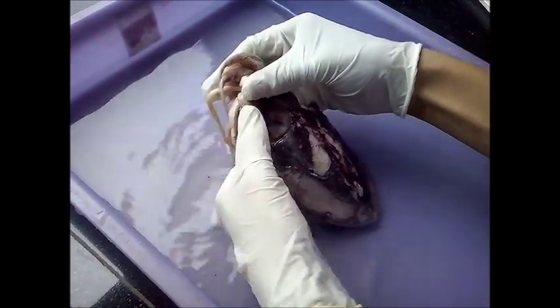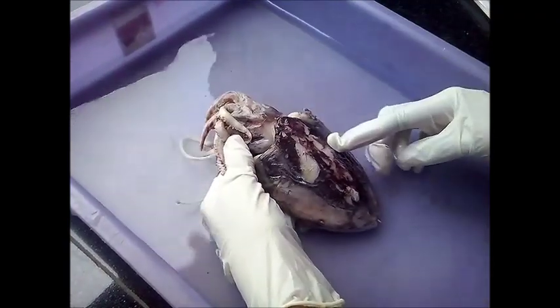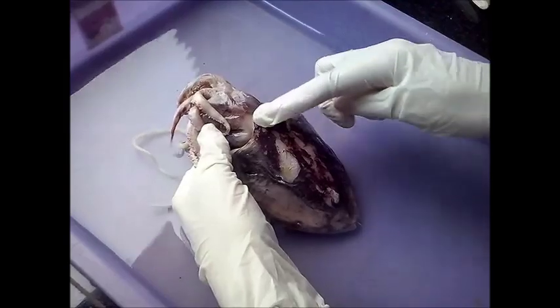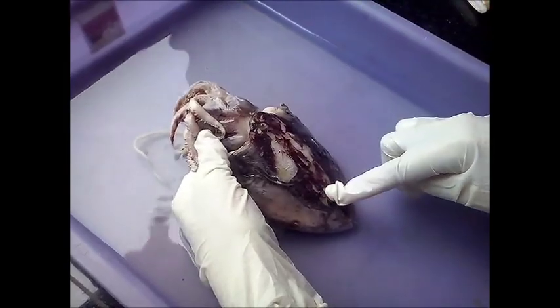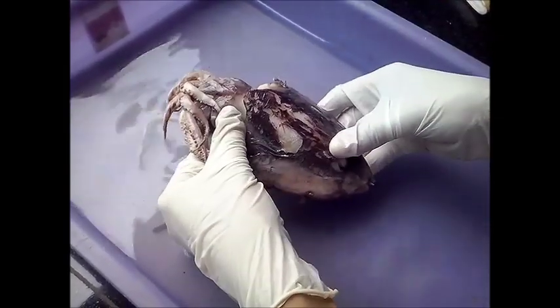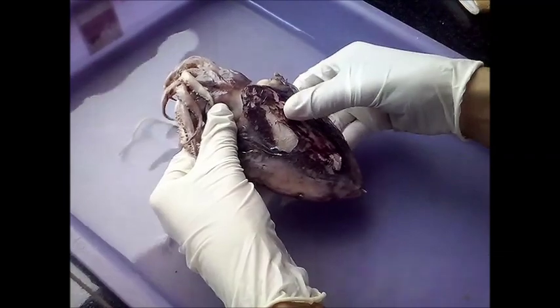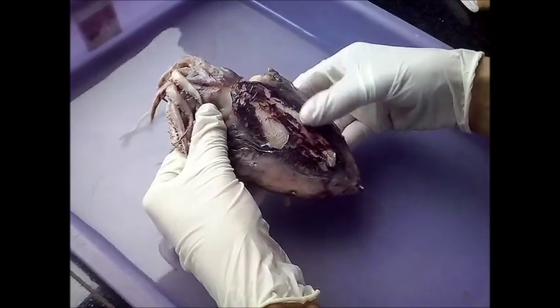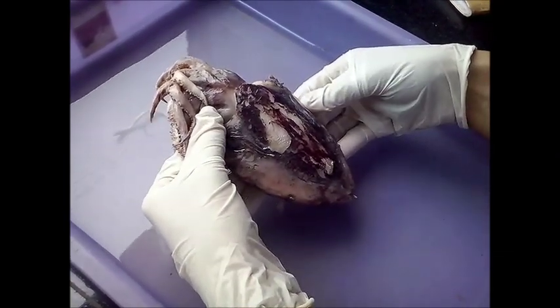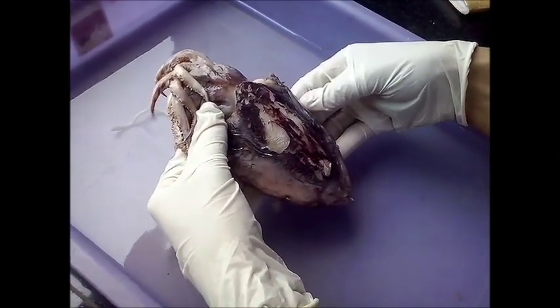On the dorsal side you can see that there is an internal shell, and it is coloured bluish-black because of the presence of pigments called chromatophores.